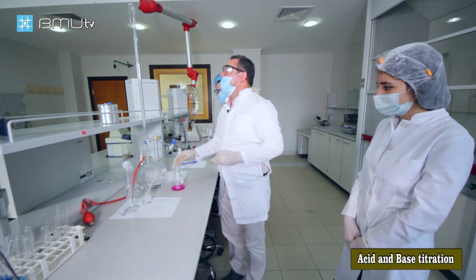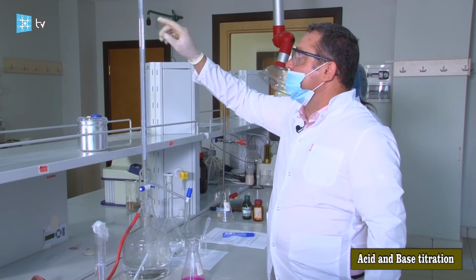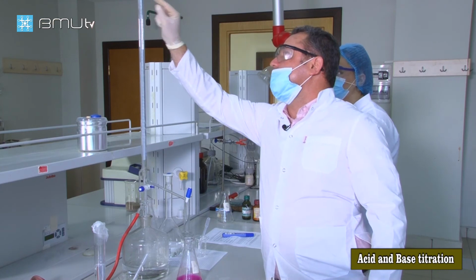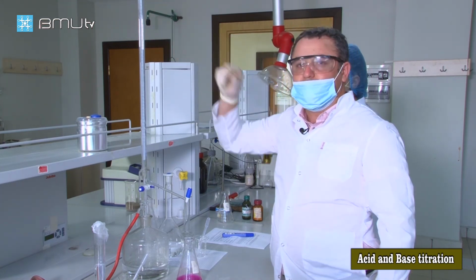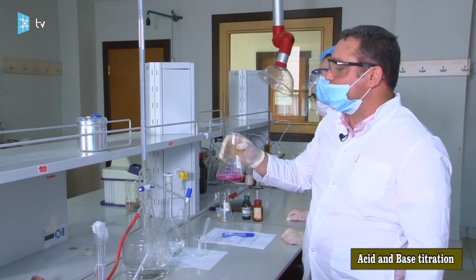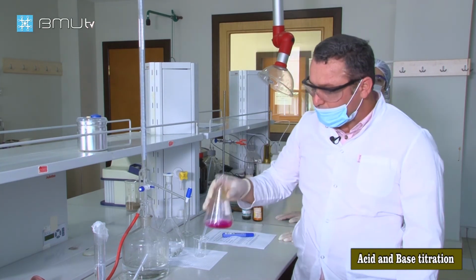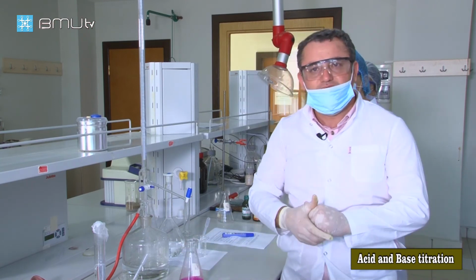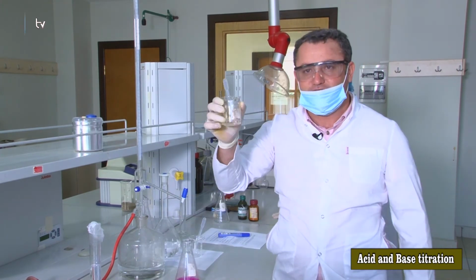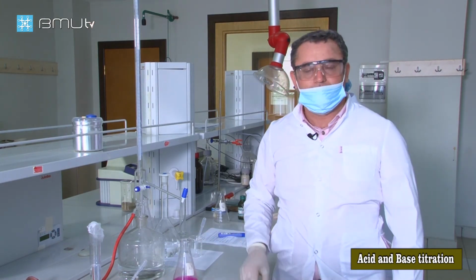And here let's calculate the volume of the sodium hydroxide solution we used for this reaction: approximately 10 milliliters of sodium hydroxide solution. After the 10 milliliters of sodium hydroxide solution, our reaction is complete. Now, after this point, we need to calculate our unknown acid concentration, and that's why we need the whiteboard.